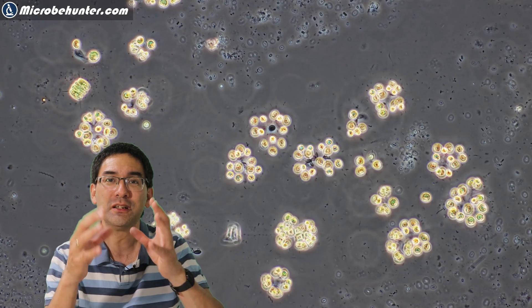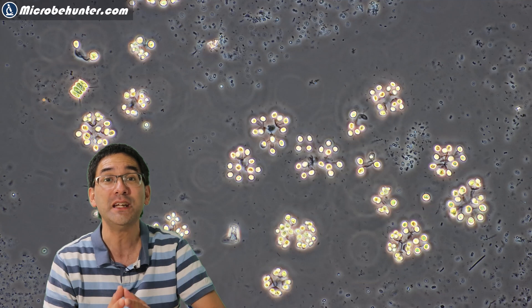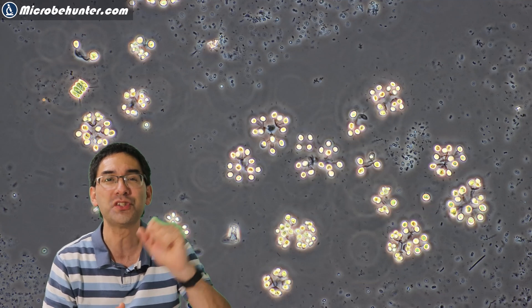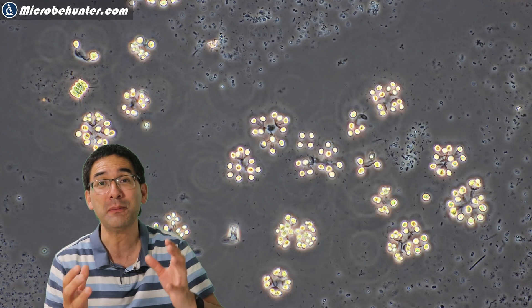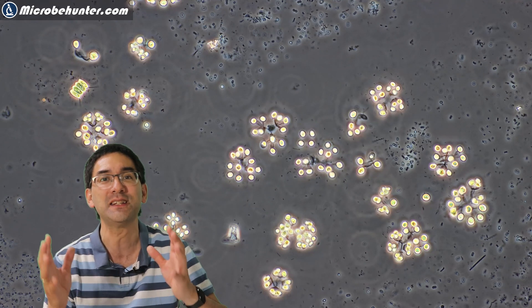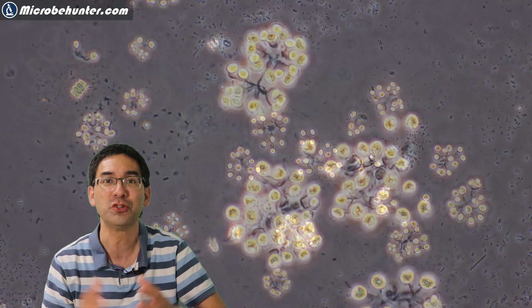Those green cluster-like structures are green algae, and the small dark dots that you see are bacteria. I measured them and they are approximately 7 micrometers — that is the diameter of one of those algae cells.